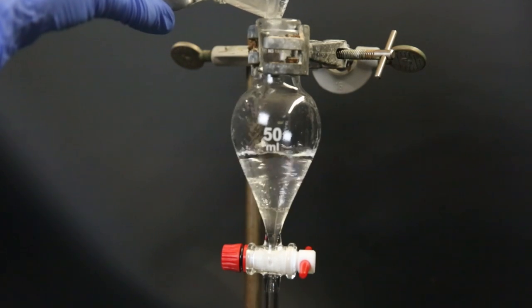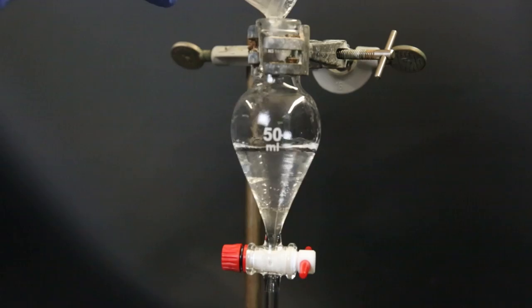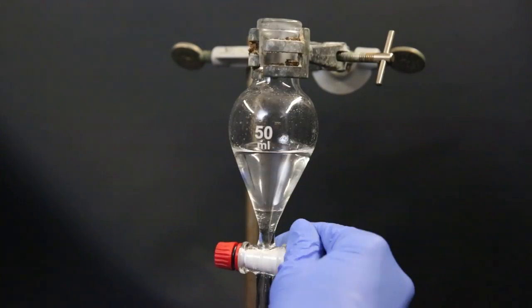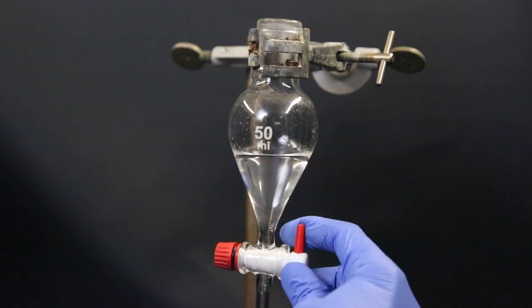Since it is less dense than water, it won't take up the product yet and I need to shake the funnel to bring them into contact. Now that the product is dissolved in the top ether layer, I can separate the layers.